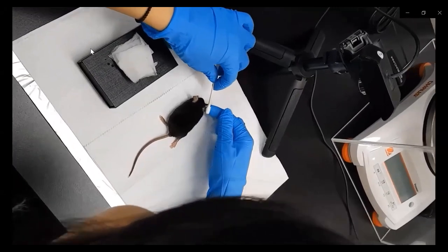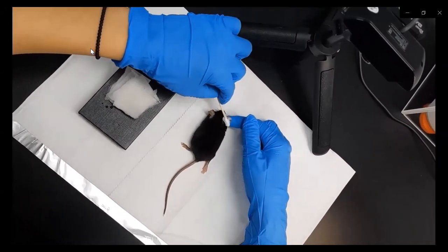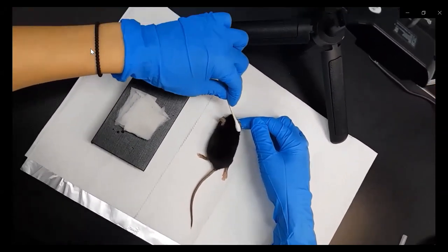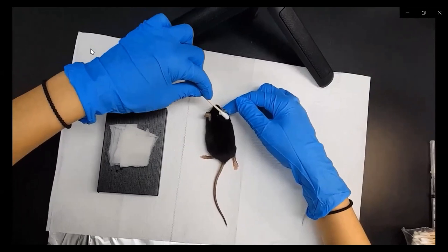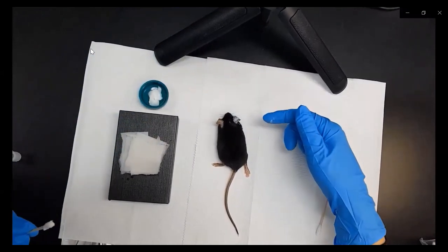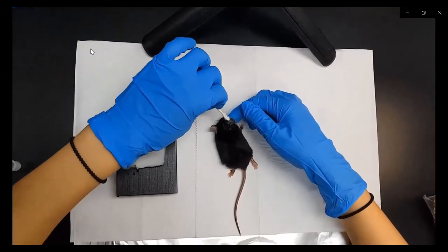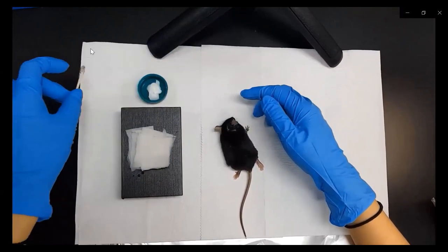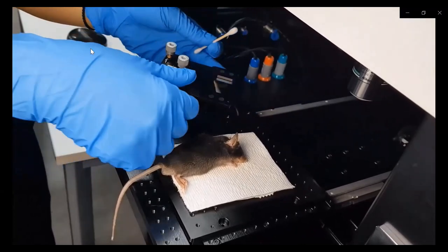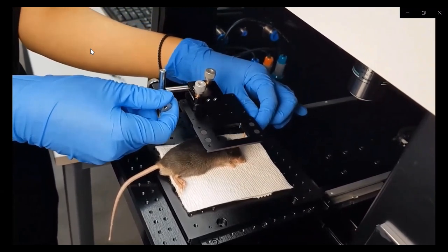The imaging area of ear skin was shaved with hair removal cream to prevent visualization of high autofluorescence signal from the hair. We apply the cream evenly to fully cover the hair on ear skin, then after a few minutes gently remove the cream and clean it with saline solution. Then the mouse model is mounted on the IVIM stage with heating plate functions, and saline is applied on the surface of the ear skin imaging area.